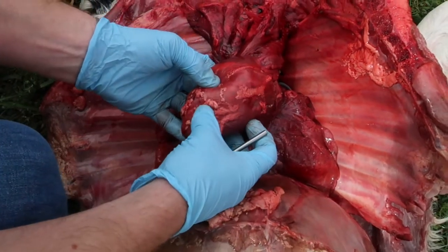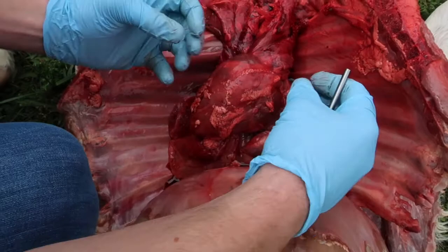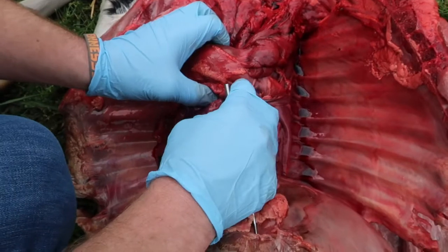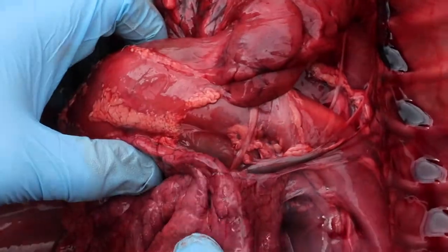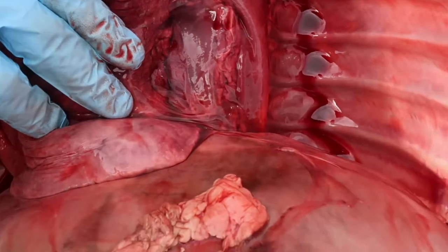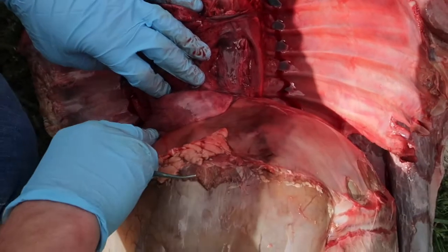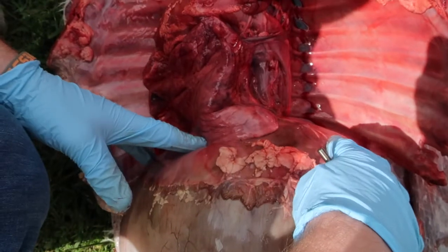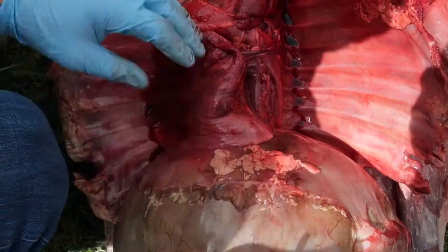The left ventricle, a very strong part of the heart, is going to press blood out to the rest of the body through the aorta. And I'm just going to pull this open here so you can see part of the aorta. And this is the aorta here, coming out the top of the left side of the heart. It's then passing down through, going down here towards the lower extremities of the animal. It actually passes through the diaphragm, which is a very strong skeletal muscle layer that basically helps the animal breathe, but also helps to maintain the organs in the abdominal cavity.